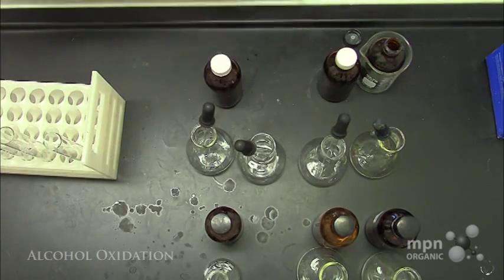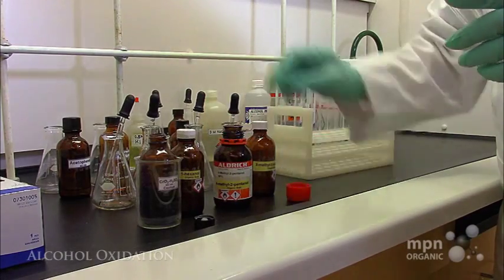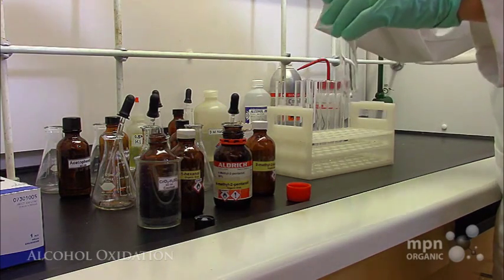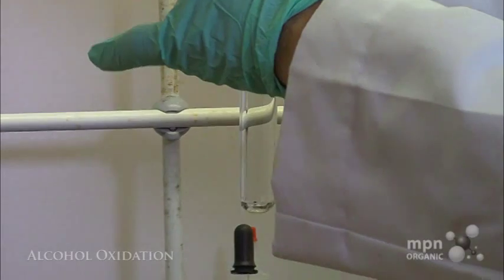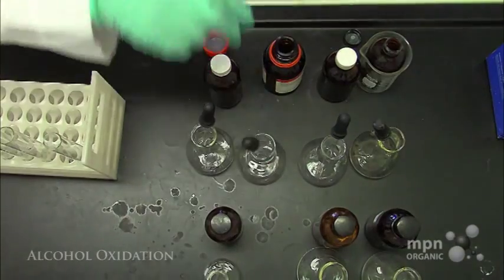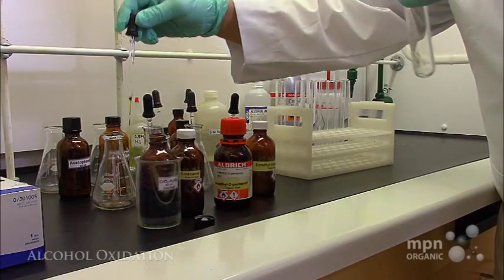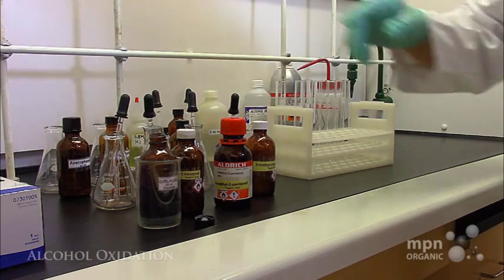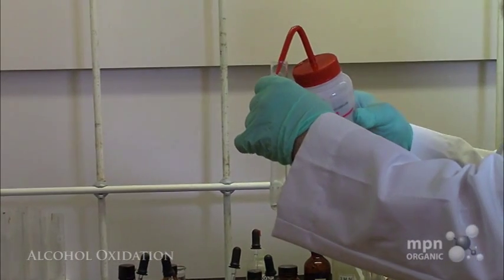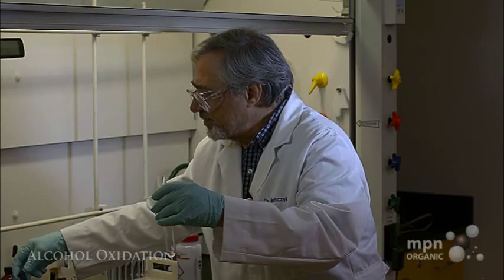Now we've got 4-methyl-2-pentanol, our secondary alcohol. Let's take a little bit of that. All we need is a couple drops of that. Put that in our test tube. A few drops of that. There we go. Now let's take some more of our oxidizing agent. Oh, got to put the acetone in there. When the acetone is used as a solvent, by the way, this reaction is called the Jones reaction.